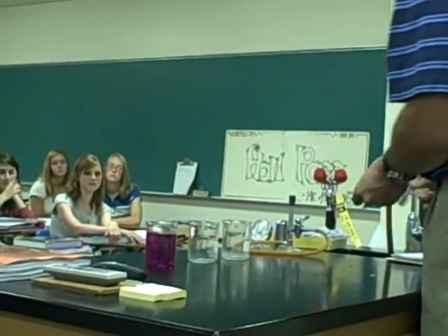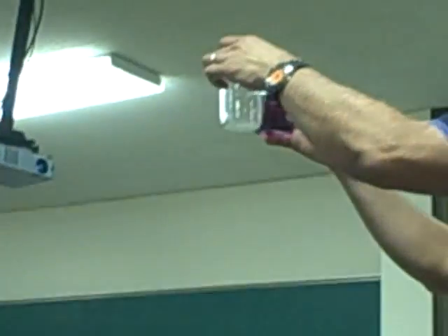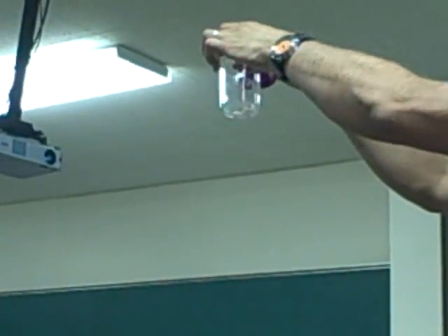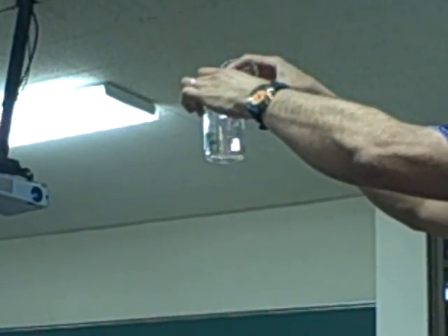And I'm just going to pour the solution into each of those beakers. So, here we go. It's pretty impressive, isn't it?